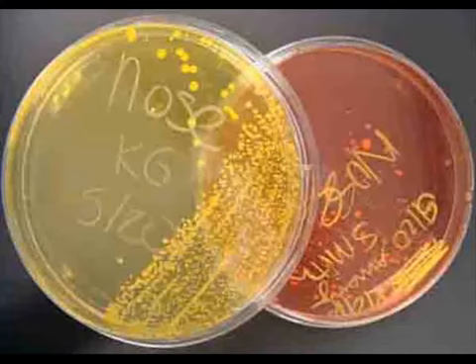We can also see that the growth on this plate has triggered the pH-sensitive dye to change color, meaning that the bacteria on this plate are mannitol fermenters. So that is what I've learned about the bacteria growing on that left plate from the selective and differential properties of mannitol salt agar.